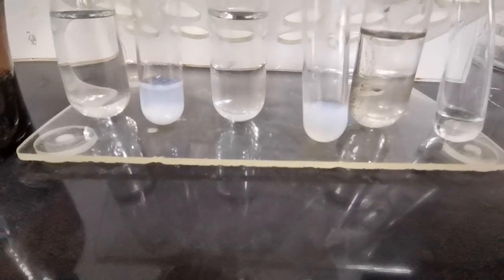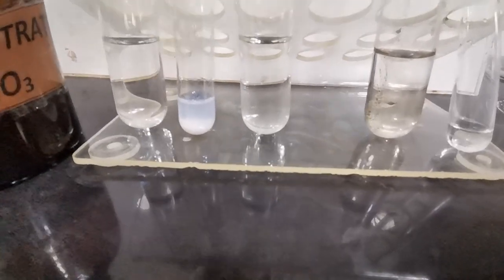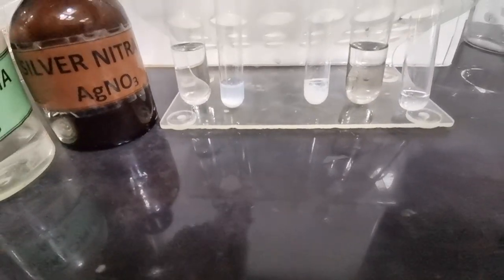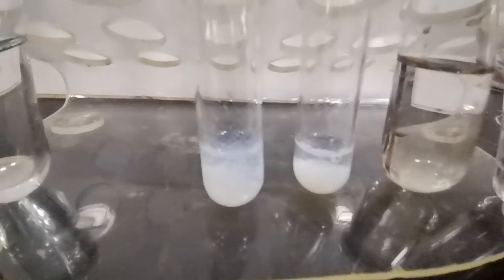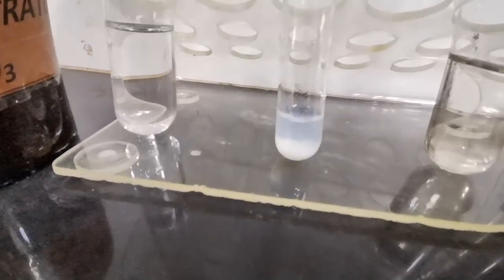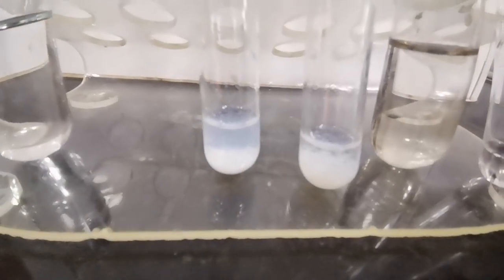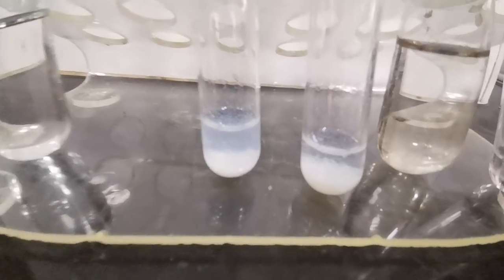a cream colored precipitate. Now this initially appears as white, but if we compare it with the precipitate in the tube that had chloride ions, we can clearly see the difference in color. As you can notice, the tube on the left has a more white appearance and the tube on the right has a less white appearance. It is more of an off-white or a pale brown or a cream colored appearance. So the white precipitate is for chloride and the cream precipitate formed is that for bromide.